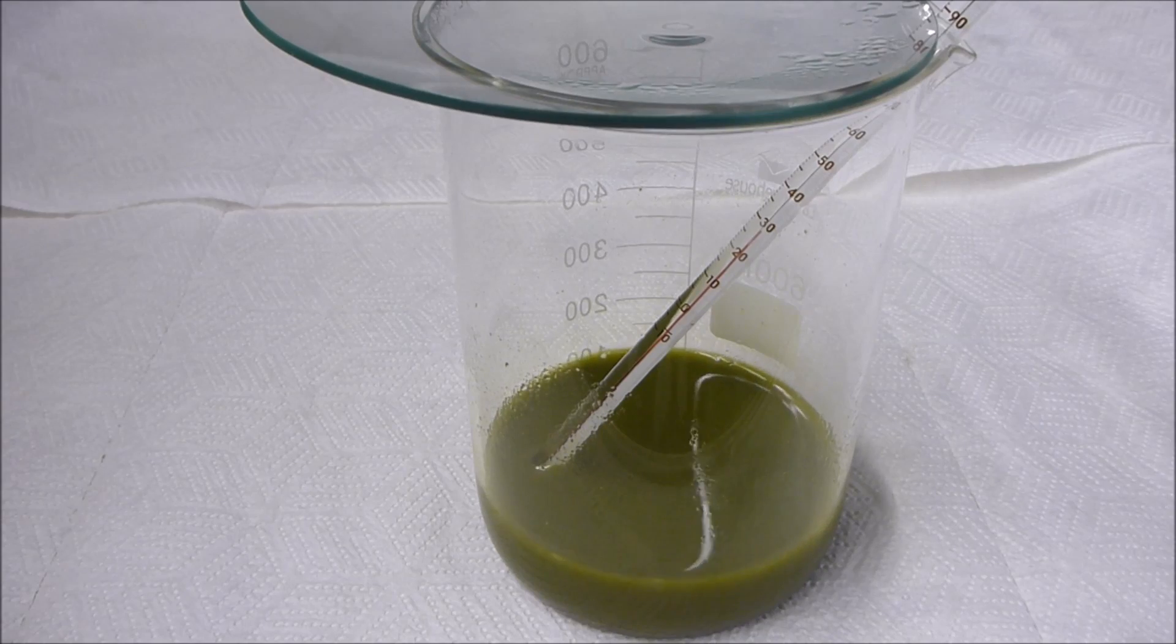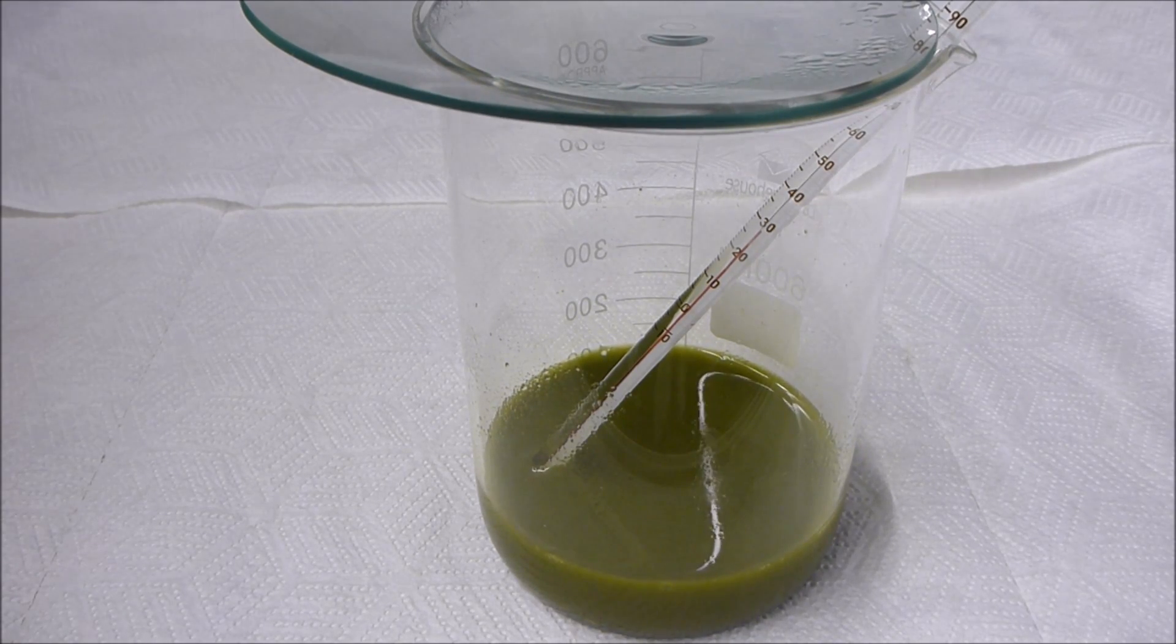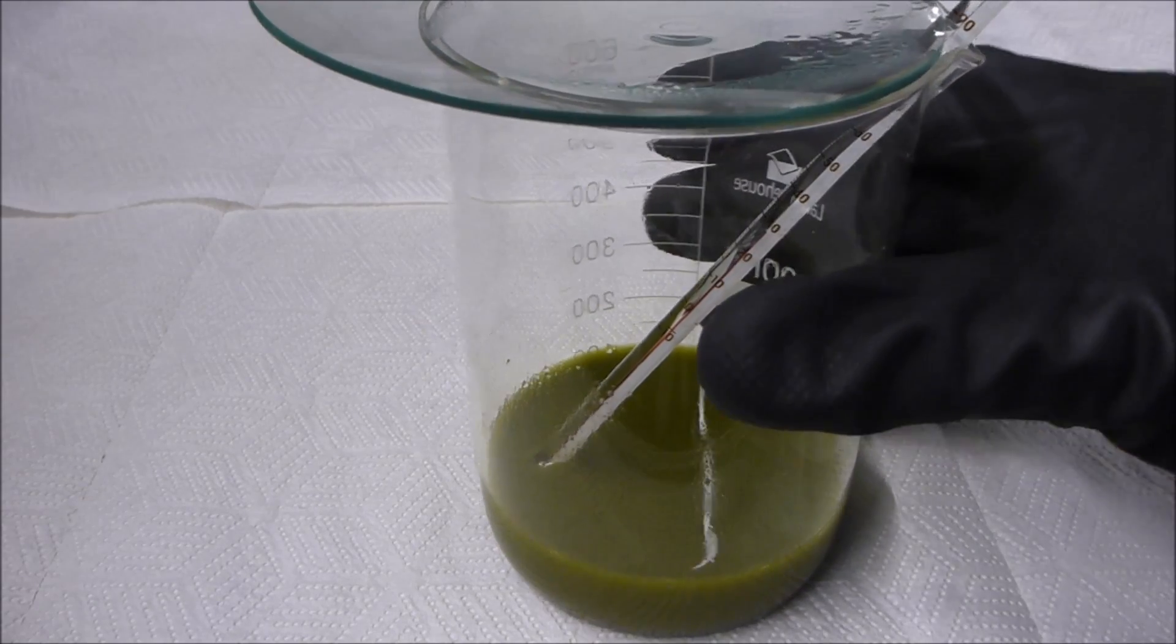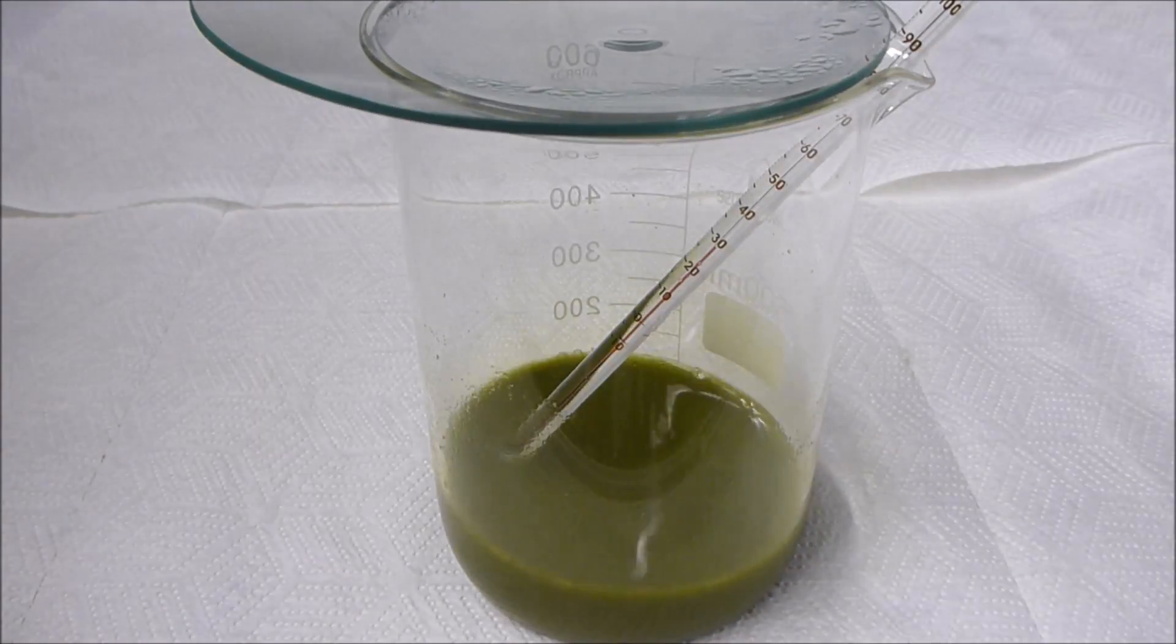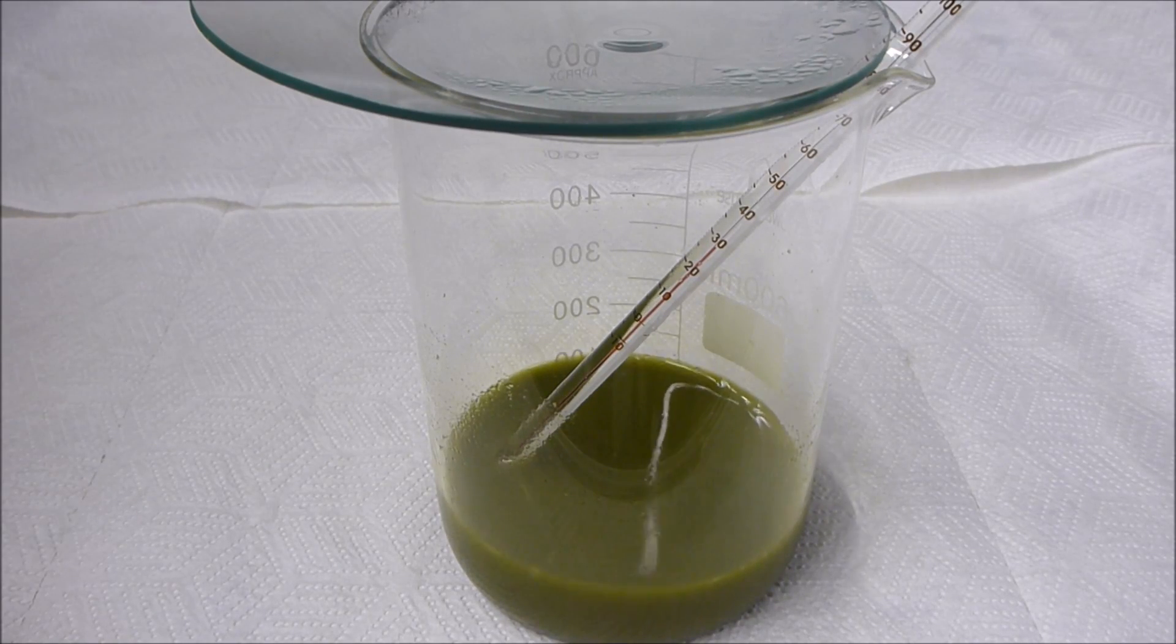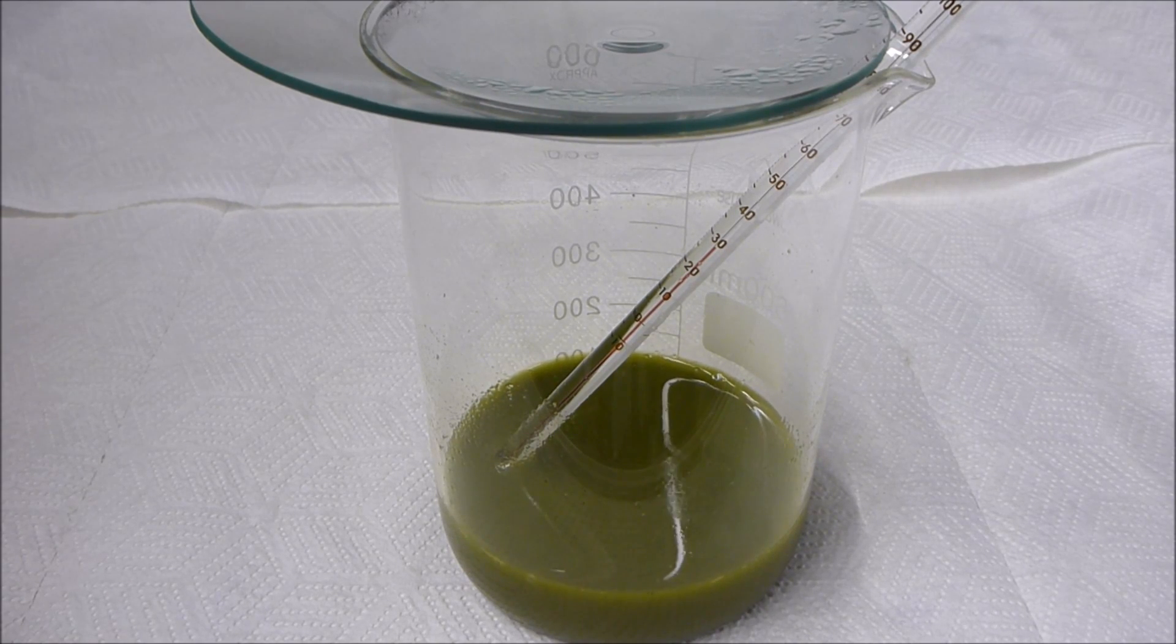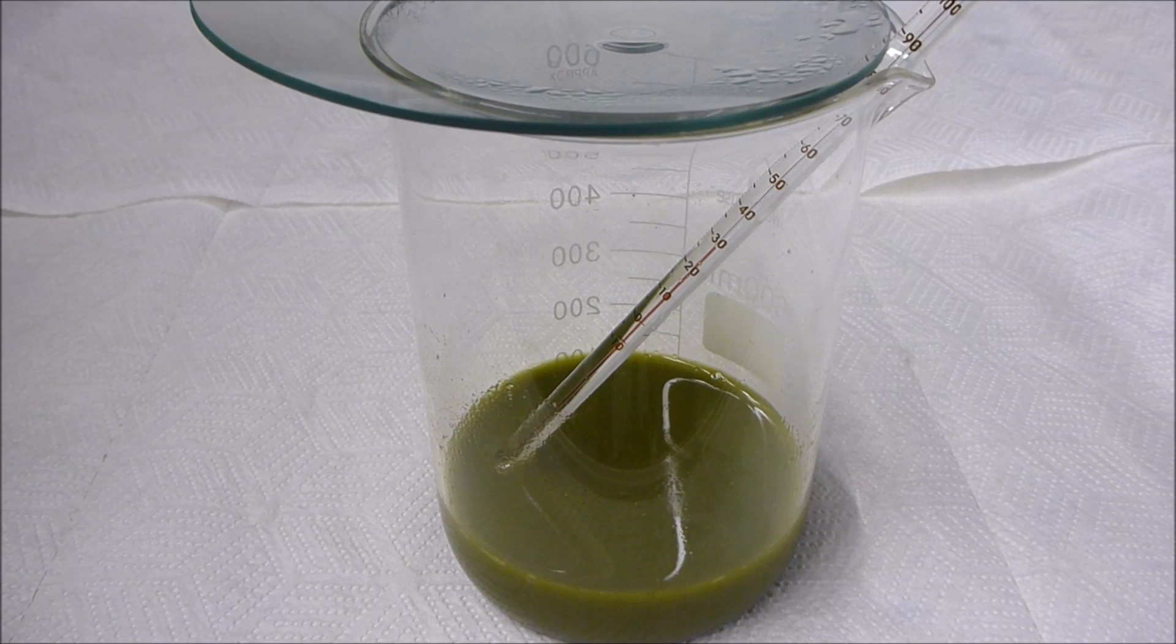Now in the past I would have diluted the solution greatly and then let it settle for a day or two and siphon off the clear solution at the top. But I figured it's probably a good time to update my techniques a little bit, so I've got a very simple vacuum filter setup.